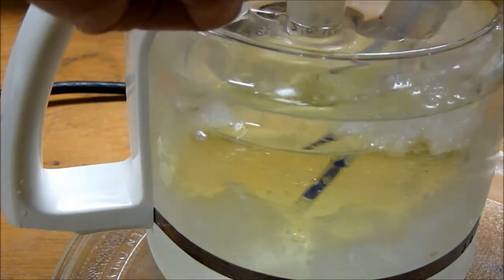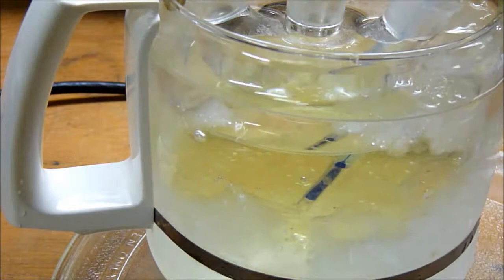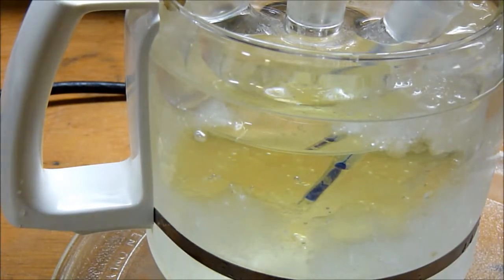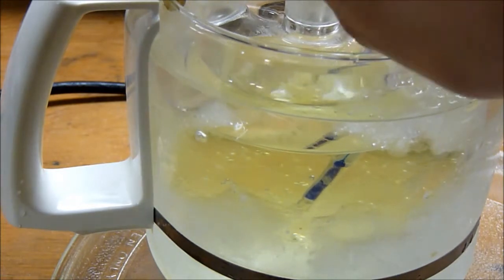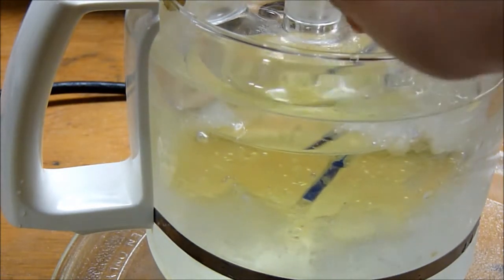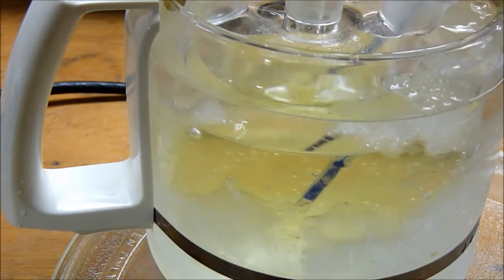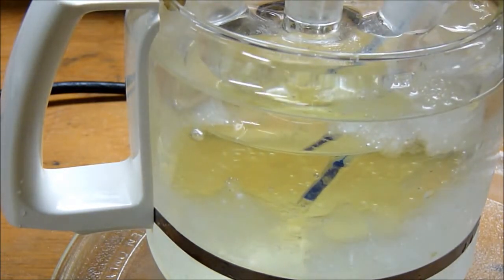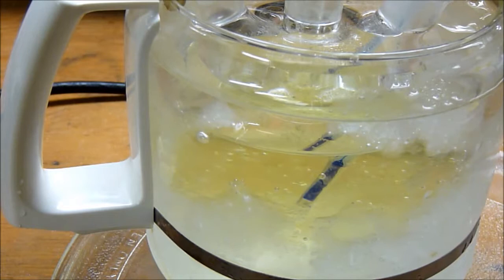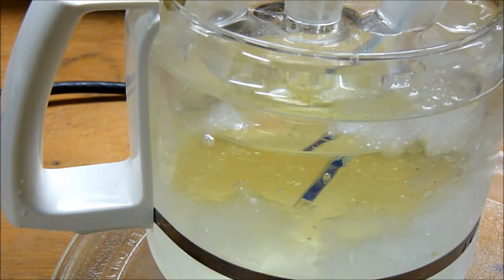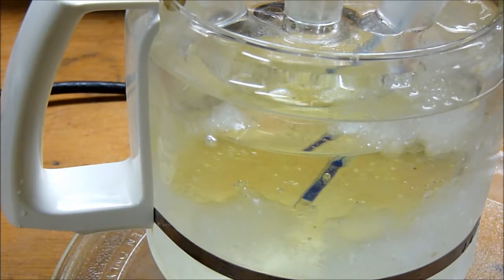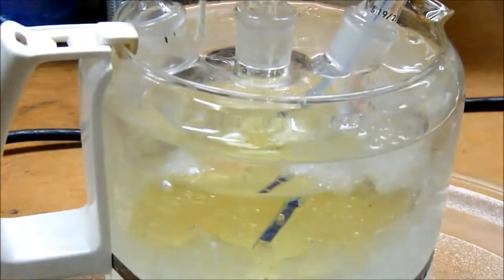We've added some acetone to the mixture. That was about a milliliter that I've added, and that will heat up and react. Once I've added all the acetone and the reaction is complete, I'll come back with another video to show what has happened.